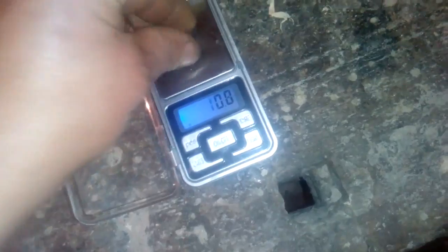Hey guys, welcome. So this is a little bit from our CPU pins, fiber CPU pins, after melting, and the size is 0.7 gram. Not bad. Not bad at all. From 140 gram pins, we got just that gold, 0.7 gram.